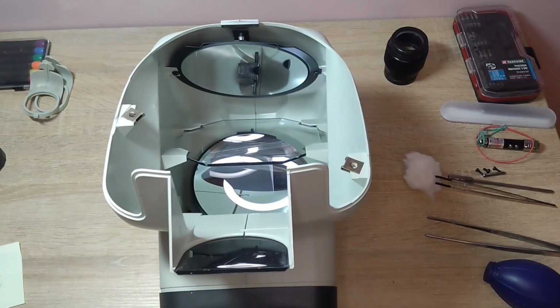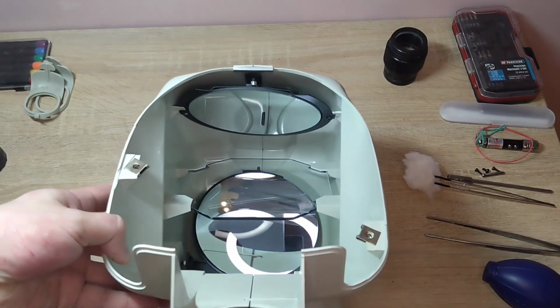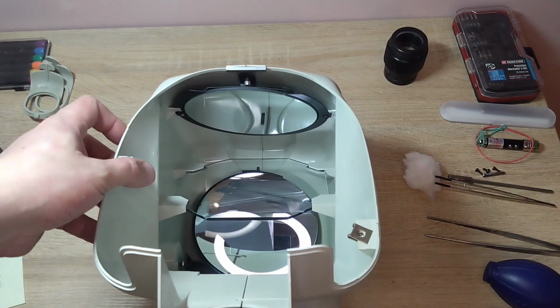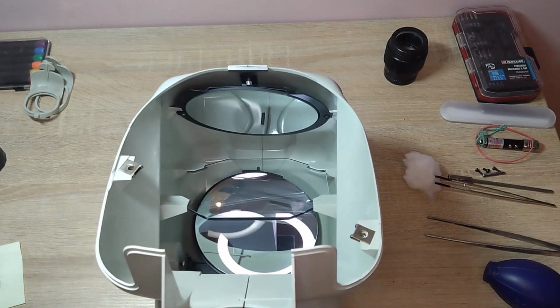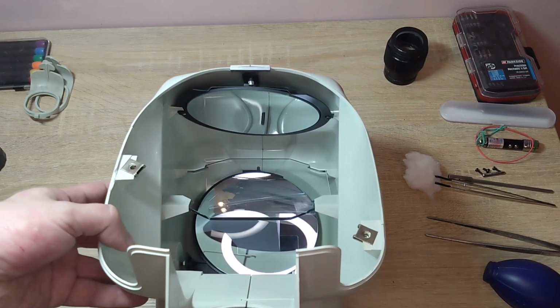And now we move on to the second part of the microscope. It is also very interesting. I have probably repeated several times that I am seeing this for the first time, disassembling it for the first time. I found some information on the internet, but there is very little, as this entire optical scheme is patented. And the optical schemes exist. I did not find them on the internet.